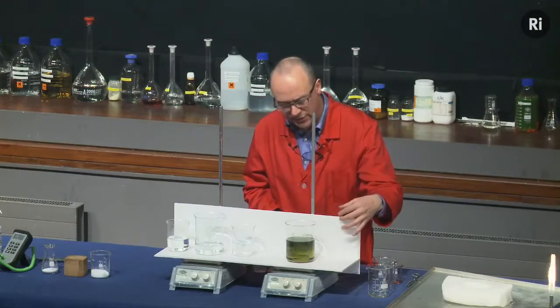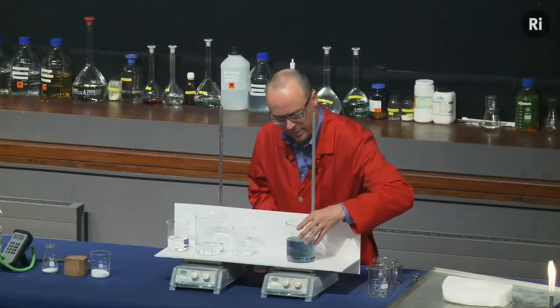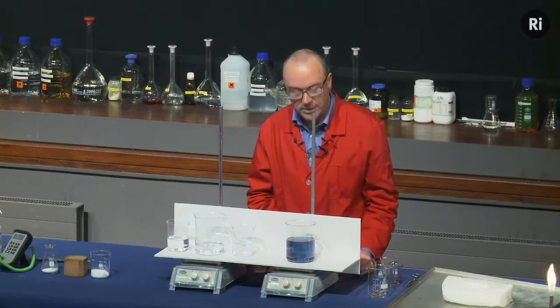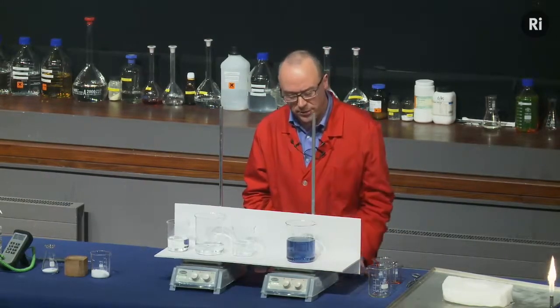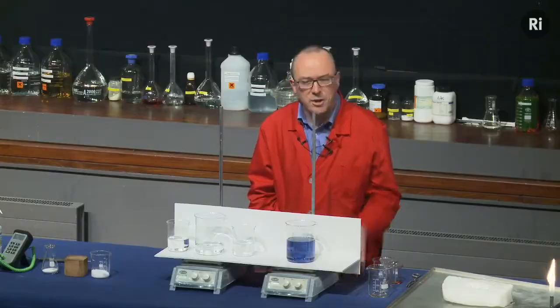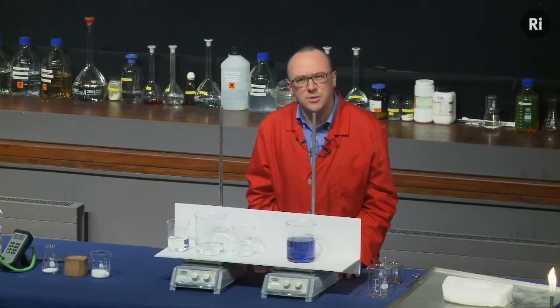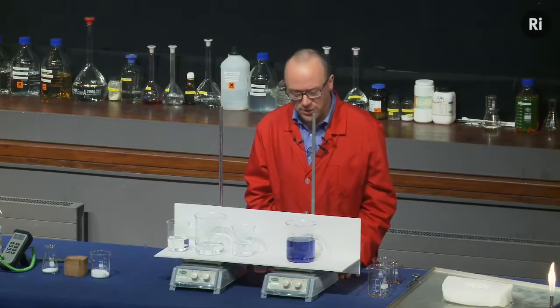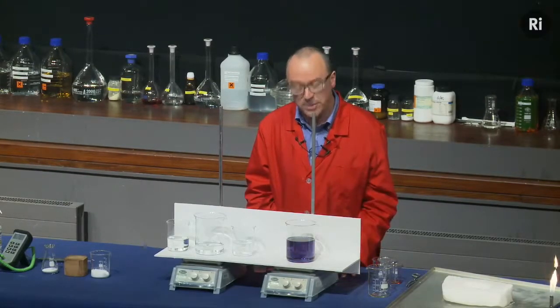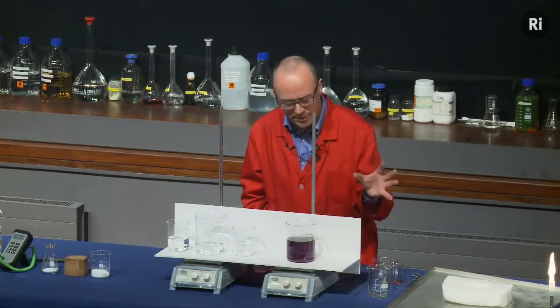So you can see that muddy colour is fading, and we've now got a green solution, and the solution is now gradually turning blue. So remember that it started out green and it's turned blue. Now Belousov was very excited by the idea of an oscillating chemical reaction, but that's sort of like a reaction that goes backwards. And people thought that reactions didn't do that sort of thing. So he wrote this up and he sent it off to the top chemistry journal in Russia, and the editors looked at this and they rejected the paper because they said that couldn't happen. Okay, it's now turned from blue to red. So it went green, blue, red.